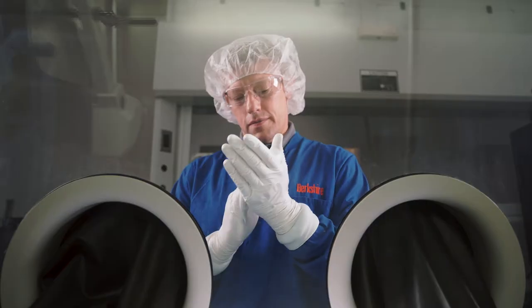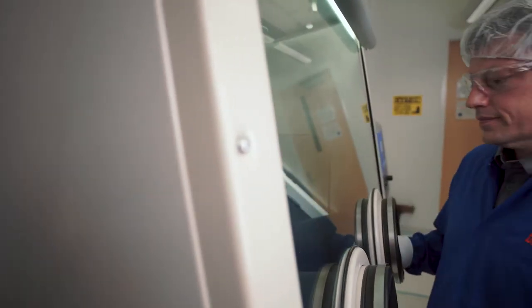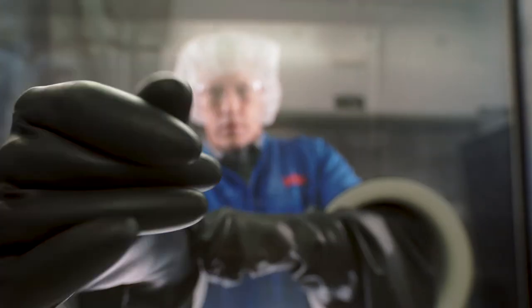Preparation for cleaning. The cleaning program should be carried out by the operators of the isolator or suitably trained personnel to a validated standard operating procedure.